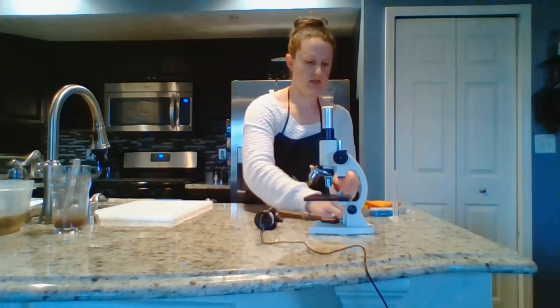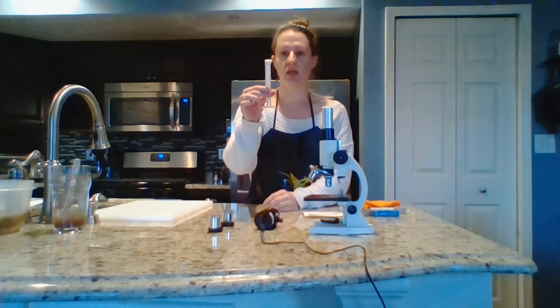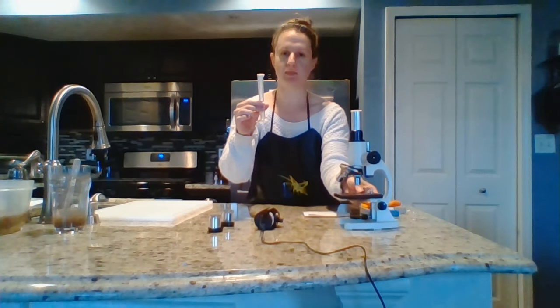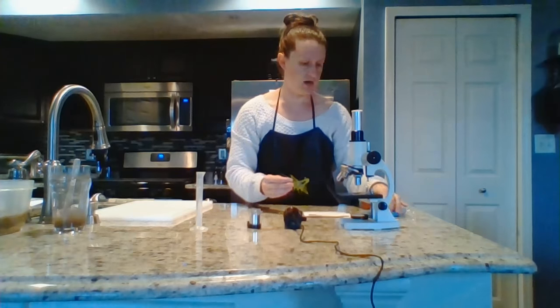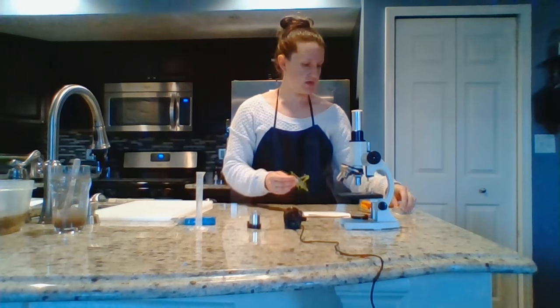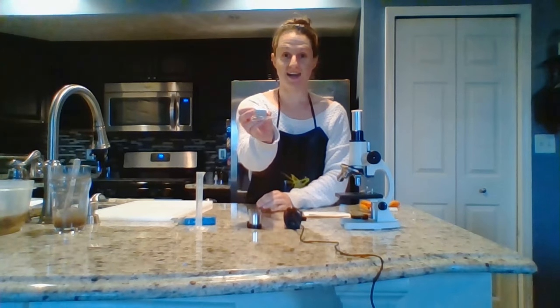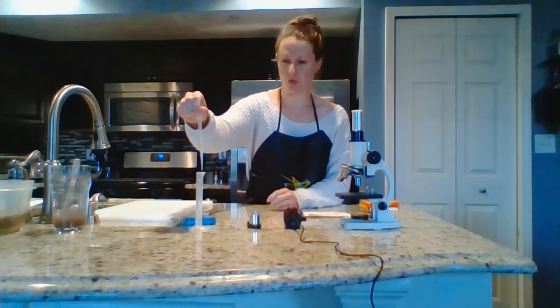For this lab, what you'll need is your microscope, your microscope light, two different sets of lenses, and some water, which I've put into this 10 milliliter graduated cylinder, but you can just use a regular cup or glass as well, and microscope slides.